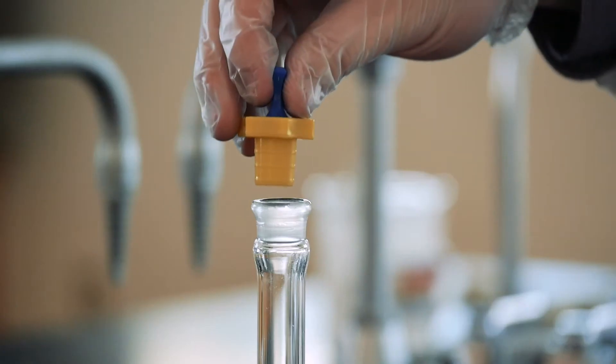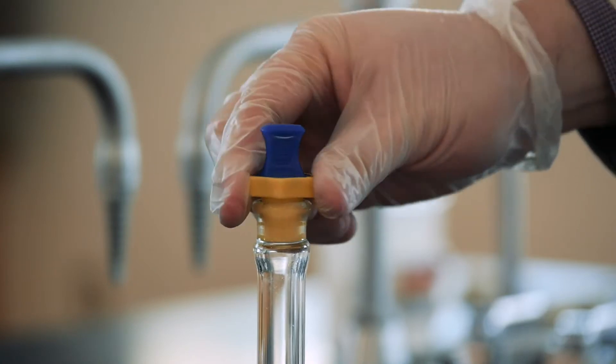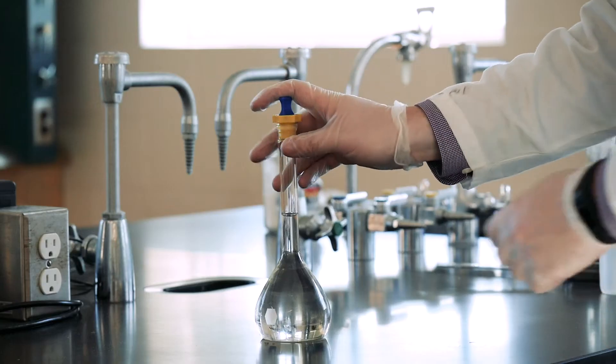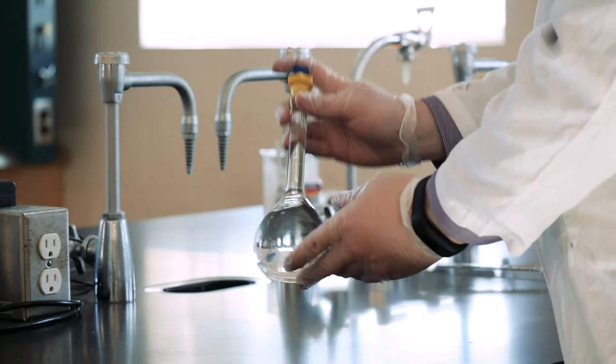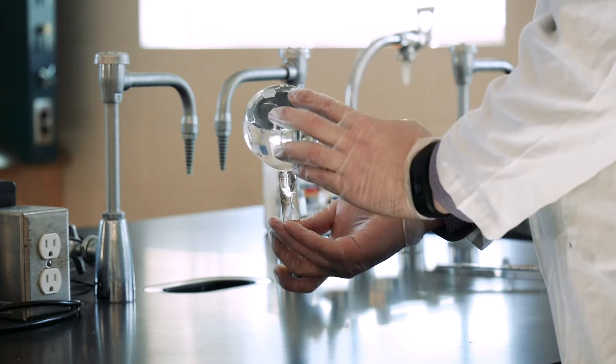Finally, firmly place the stopper on the flask, then rotate a quarter turn. Then invert the flask 20 times or more slowly to ensure the solution is thoroughly mixed.